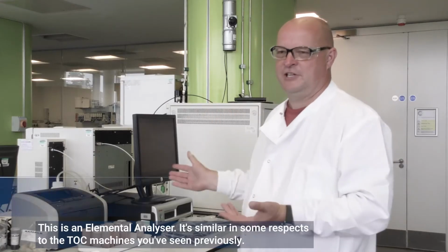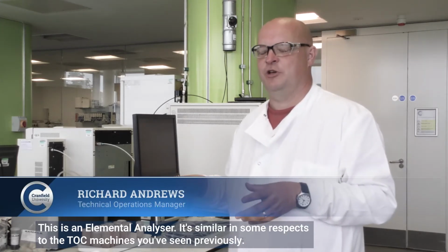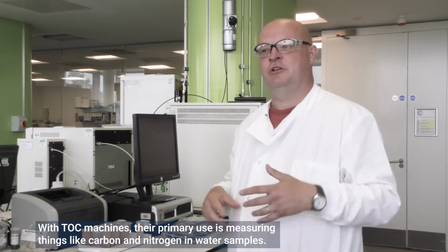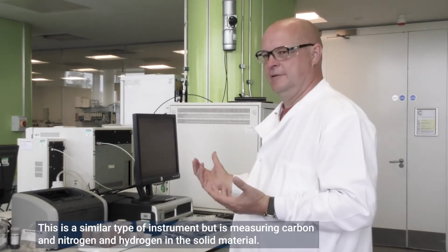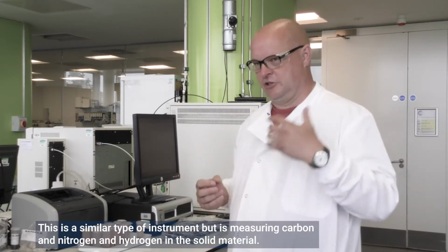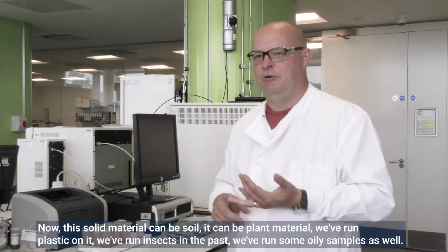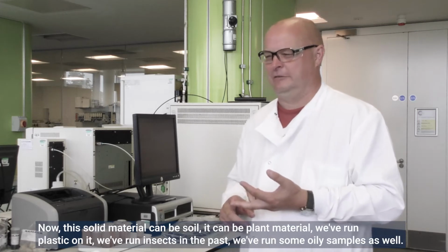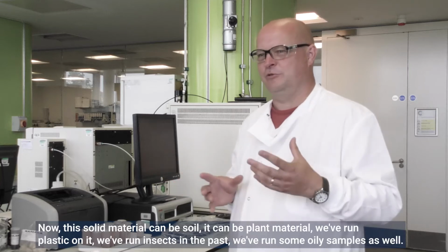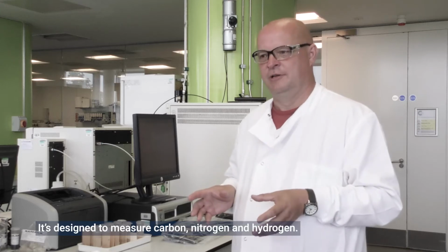This is an elemental analyzer. It's similar in some respects to the TOC machines you've seen previously. The TOC machines' primary use is measuring things like carbon and nitrogen in water samples. This is a similar type of instrument, but it measures carbon, nitrogen and hydrogen in solid material. This solid material can be soil, it can be plant material, we've run plastic on it, we've run insects in the past, we've run some oily samples as well. It's designed to measure carbon, nitrogen and hydrogen.